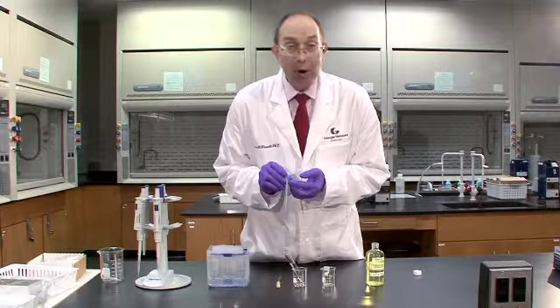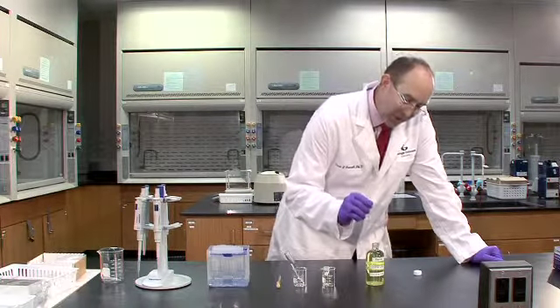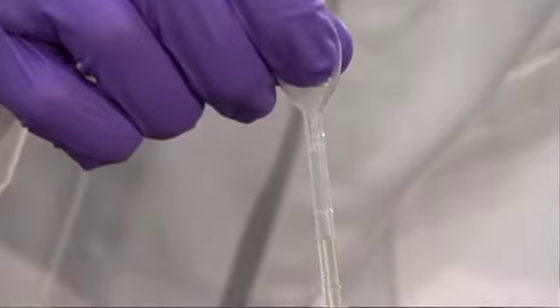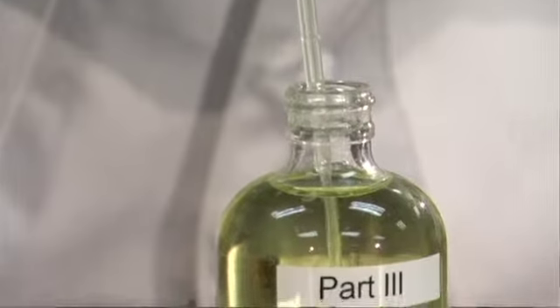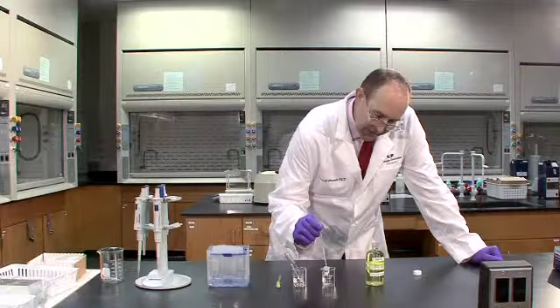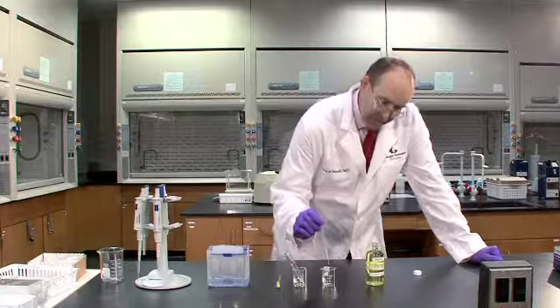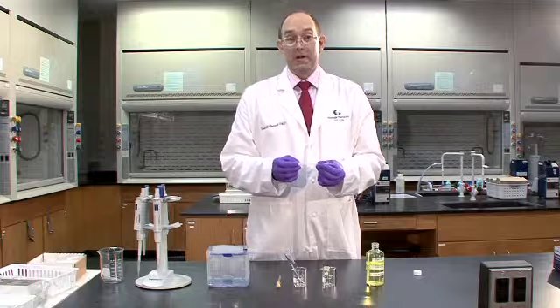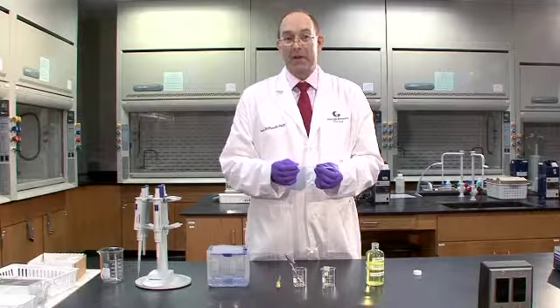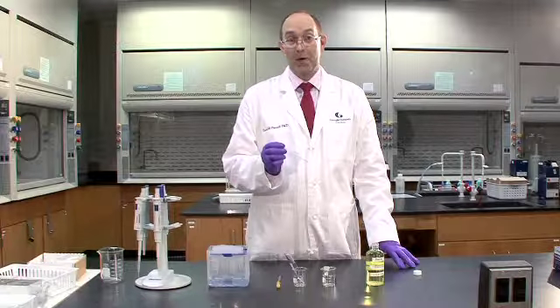So I want to draw approximately 1 milliliter of my reagent into the disposable plastic pipette. I dip the pipette into the reagent and I draw up liquid until I'm at the 1 milliliter line. I move to my container and I push the liquid out of the disposable plastic pipette. So many of the experiments we use will require approximate volumes of organic solvents in order to conduct the experiment. So the disposable plastic pipette is the most efficient method of determining approximate volumes.